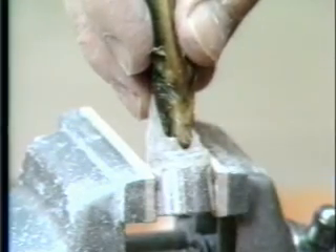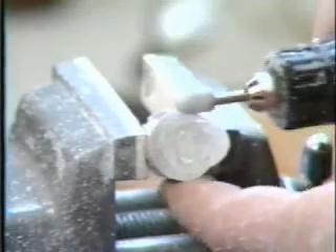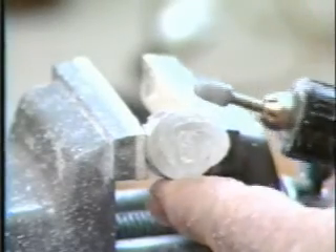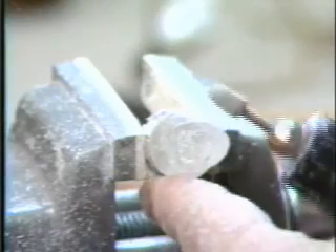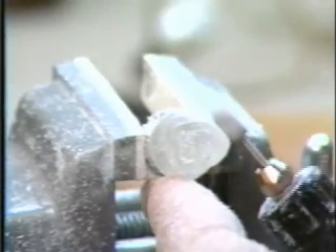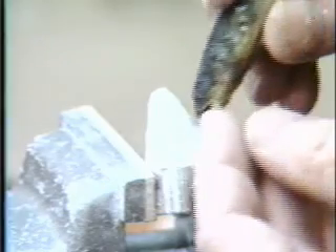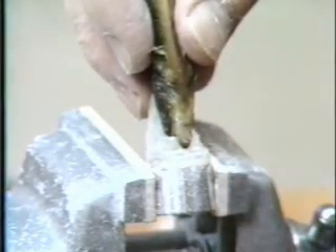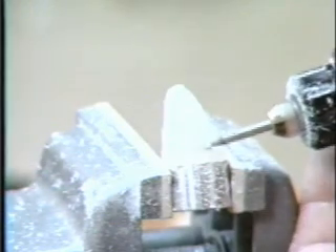Another feature which establishes the fundamental mold shape is the ledge which supports the upper jaw. Because the lower jaw goes underneath, it should be thin with sufficient underside clearance so as to avoid forcing the lower jaw into an injurious gape, as shown in this bad example. The distance the ledge goes into the mouth should not exceed clearance in the smallest fish which will be used. Smooth the external surface and provide relatively flat surfaces, especially on the side toward the tagger, so the fit of the fish in the mold can be most effectively observed through the clear plastic. The inside of the mold should be smoothed so there are no bumps or ridges to tear or bruise the fish. The jaw ledge should be smooth and flat, and the edges where the teeth and maxillary bones may scrape or catch should be slightly relieved with a fine cutter.